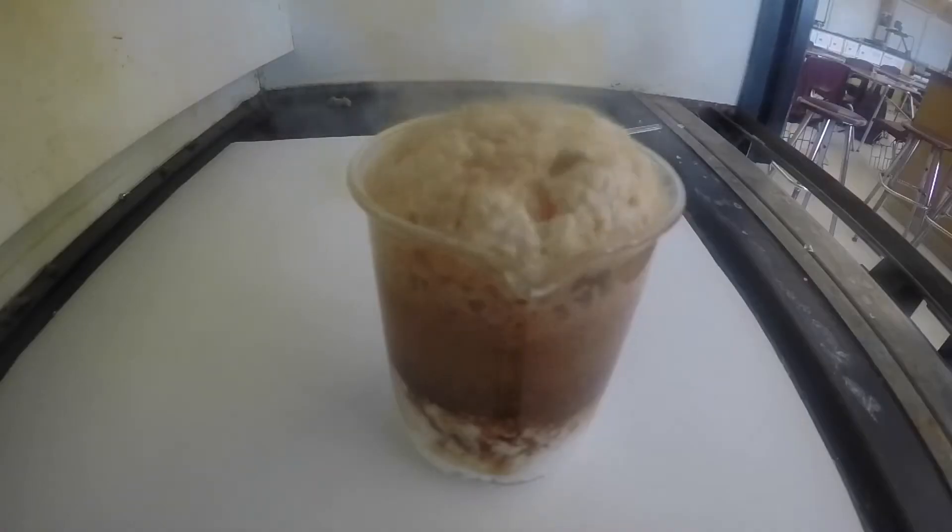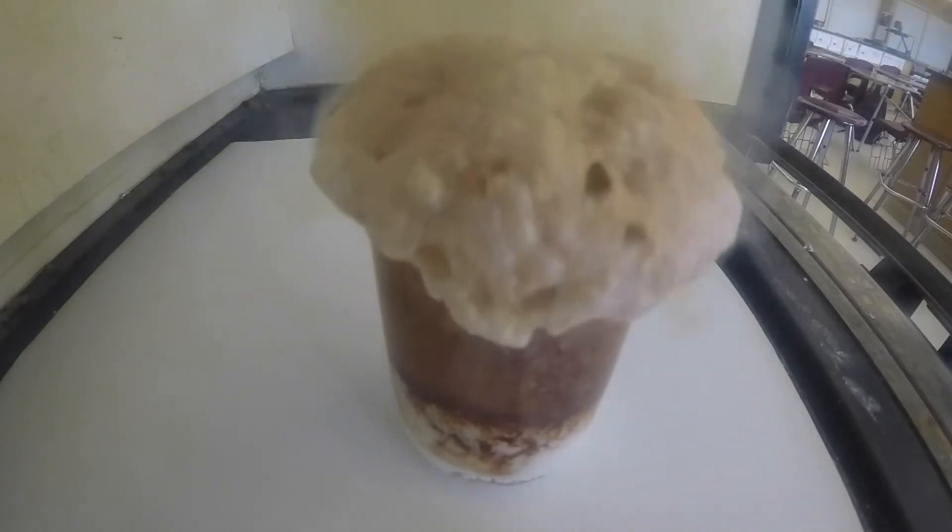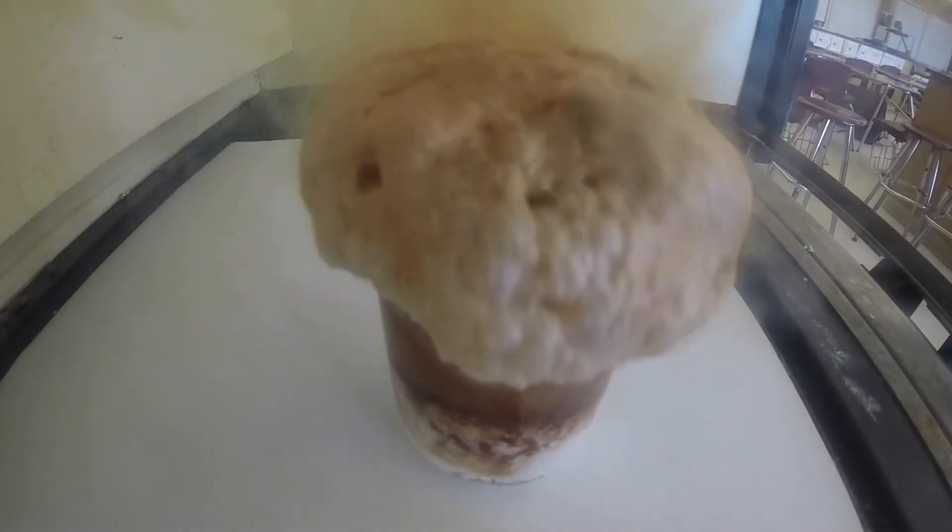And then things got out of hand really quickly. You can see the whole thing got really foamy and built up and over the side of my beaker in the fume hood. And it was really scary and it lasted a few seconds and I wasn't sure what was happening. And thankfully, it calmed down. But then of course I had to stop what I was doing and do a massive clean up inside the fume hood.